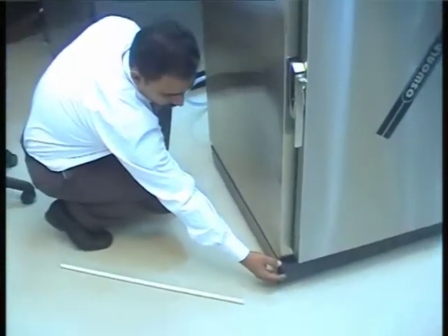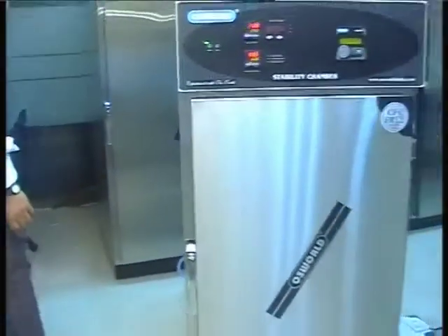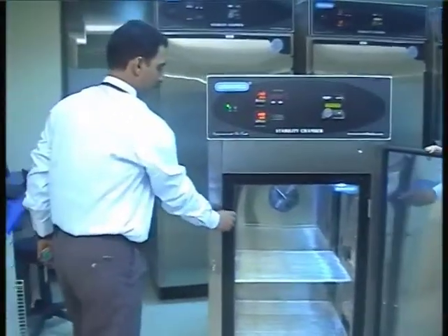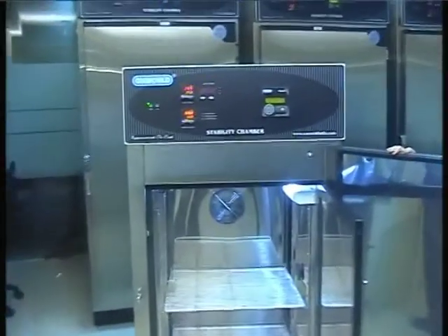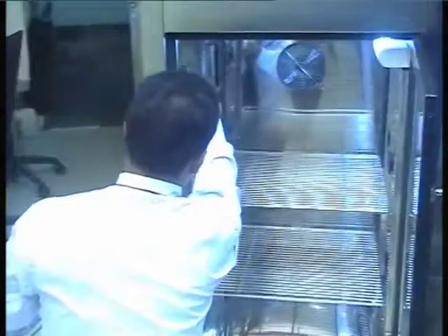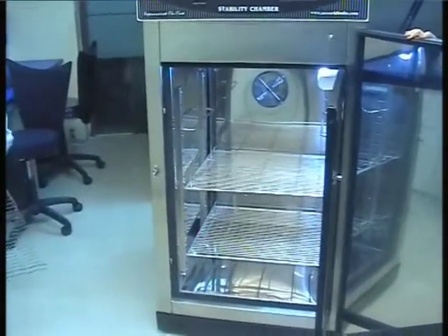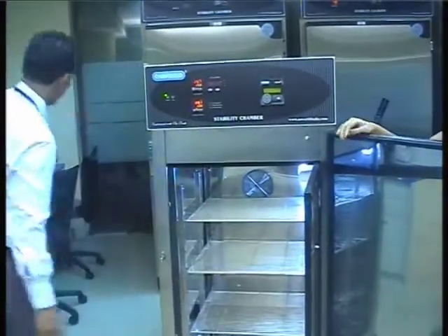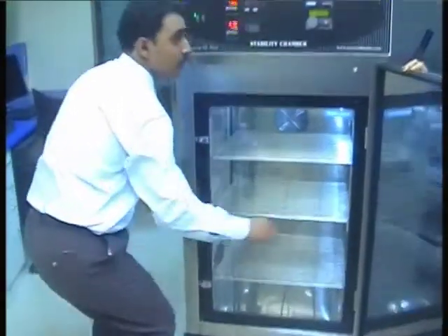Connect the wheel cover bottom loose panels which are provided as per the notation written on the panel. Open the main door and the viewing glass door. Place the tray supports in respective slots on either side of the chamber. Place the tray on the supports and then close the blower and the chamber.